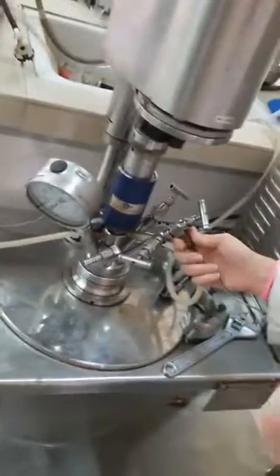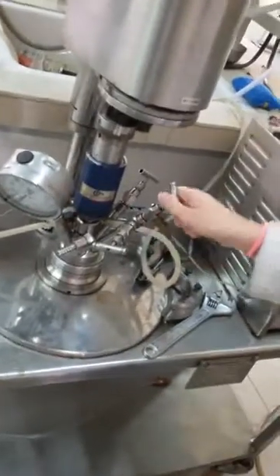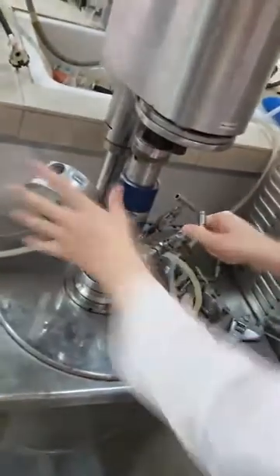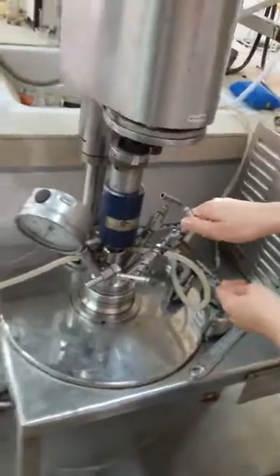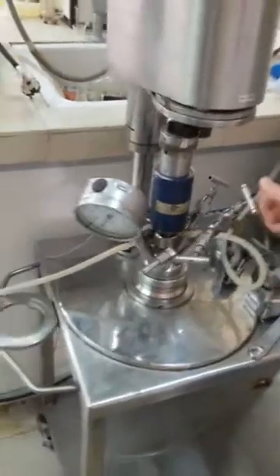I have here the inlet for the gas I am using. I can just switch this on like that, and this is closed.